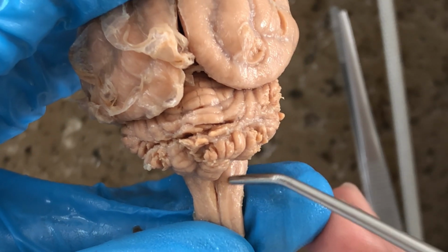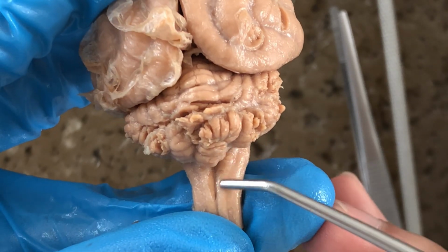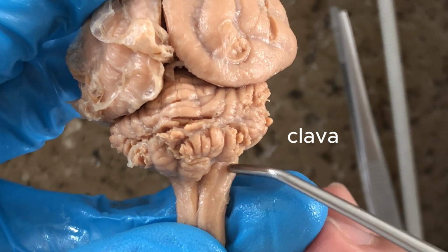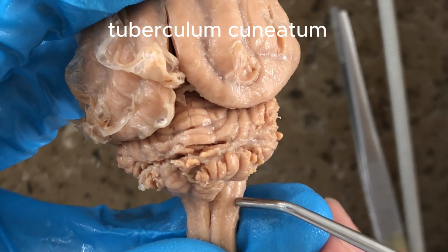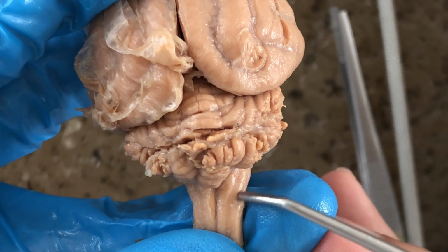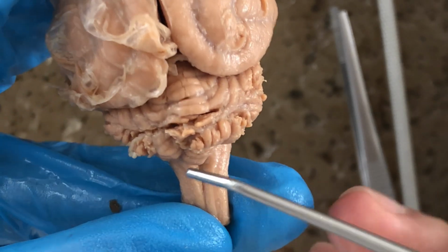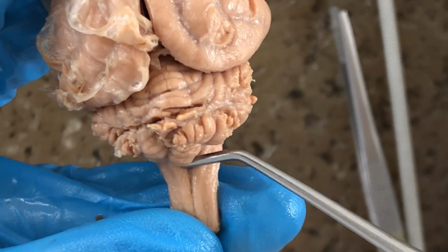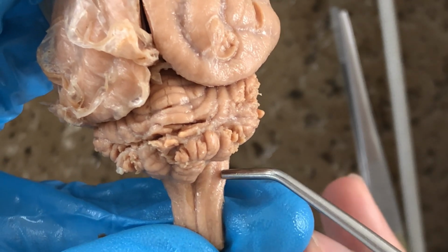And this, specifically these median longitudinal tracts here, are the clava, and lateral to it would be the tuberculum cuneatum. So both are somatic sensory columns. Clava, tuberculum cuneatum. So in general, the arrangement of fibers in the central nervous system is that dorsally you'll find the sensory tracts like these structures, the clava and tuberculum cuneatum.